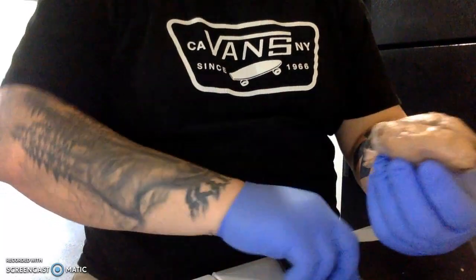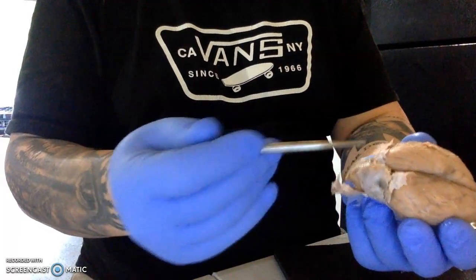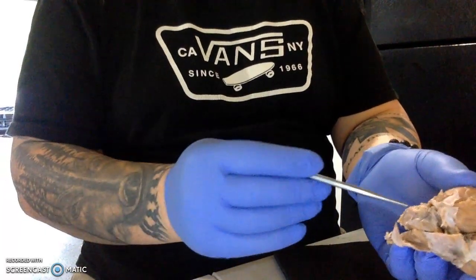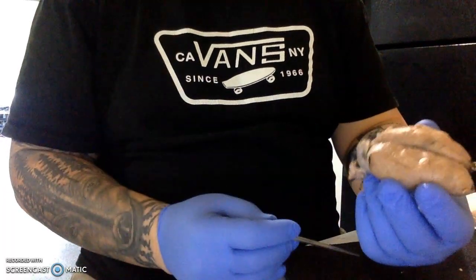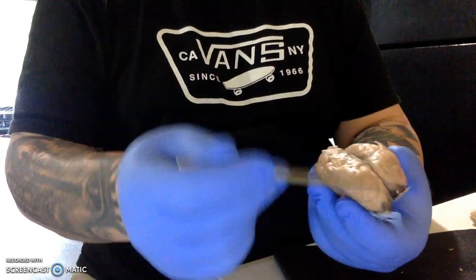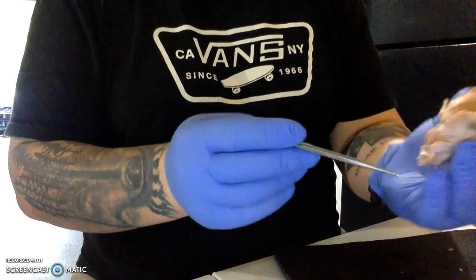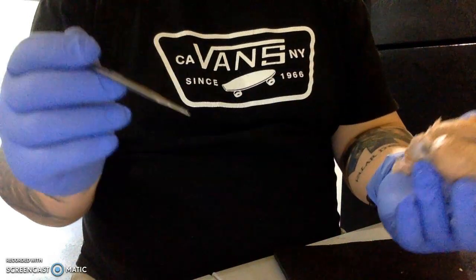When it was together like this, I was able to identify a few different structures. First of all, the brain tissue itself was covered in the meninges, and we removed most of those, but you can still see some of the meninges left over here. We have different lobes of the brain, so we have the frontal lobes here at the front. We have the parietal lobes. Here on the sides are the temporal lobes, and on the back we have the occipital lobe.